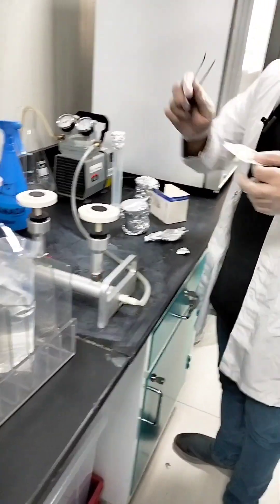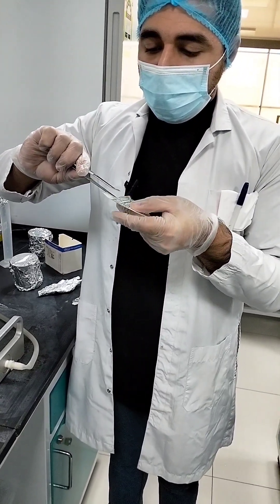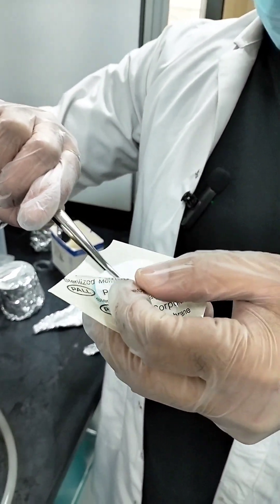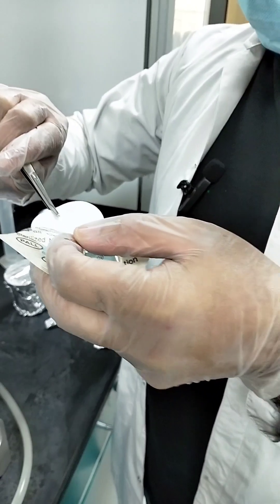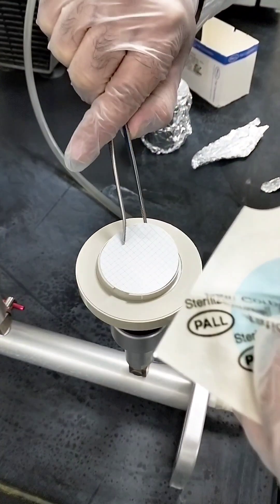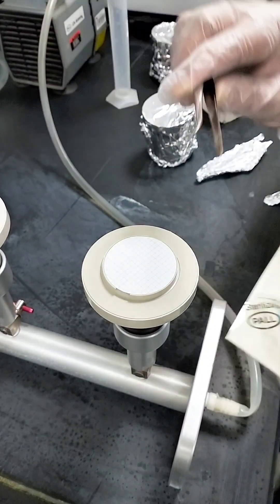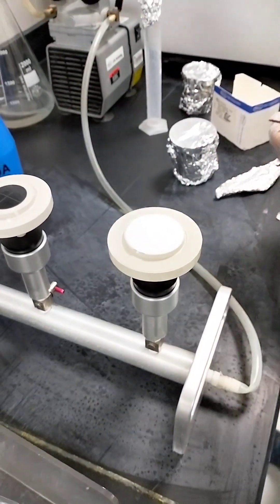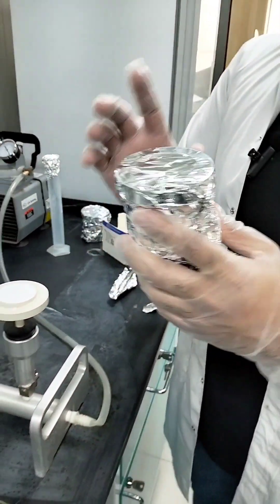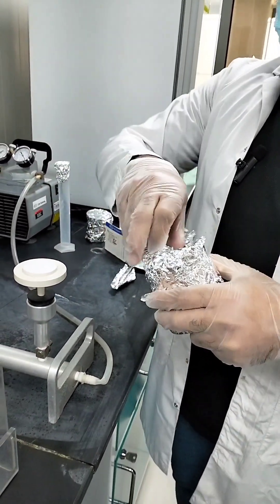Now with the forceps, using the forceps you carefully take the filter paper. You carefully place it on the filter part of the filtration assembly. After that, you need to put the glass funnel part of the filtration assembly in place. Disinfect this glass funnel as well.